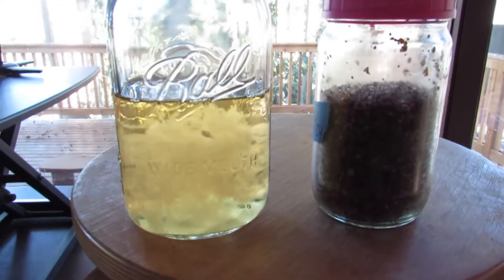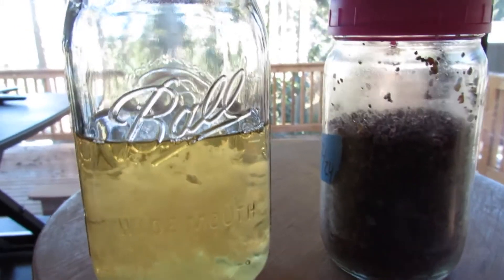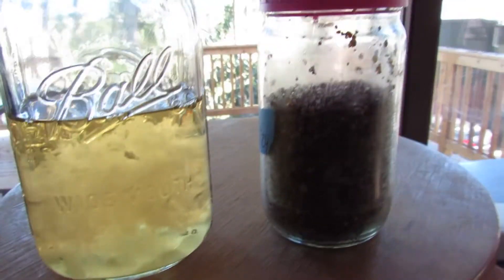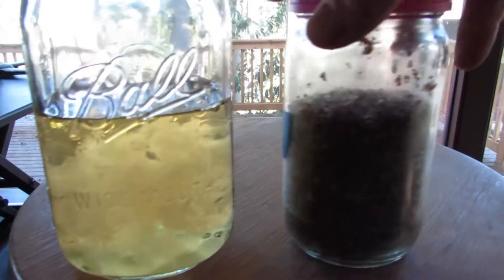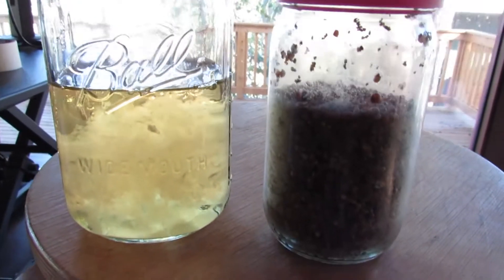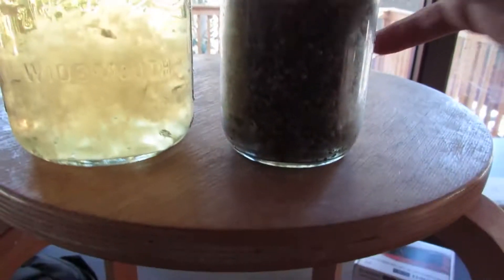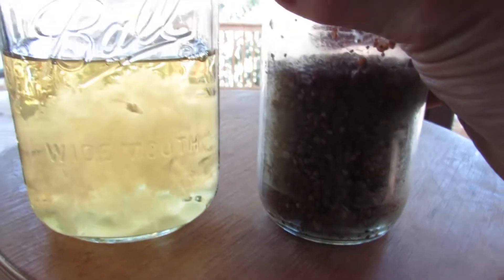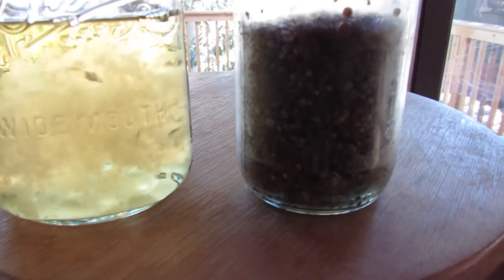This is super cool because it may be the way I'm making agar — I'm still very much a rookie when it comes to agar — but it seemed like it was taking days and days for it to start growing on agar for me to find out if it was viable. Contamination shows up very soon on agar plates, but healthy mycelium can take quite some time to start growing. I was becoming impatient, so I came up with this idea instead and it worked. We've got a faster way to test out our liquid culture.